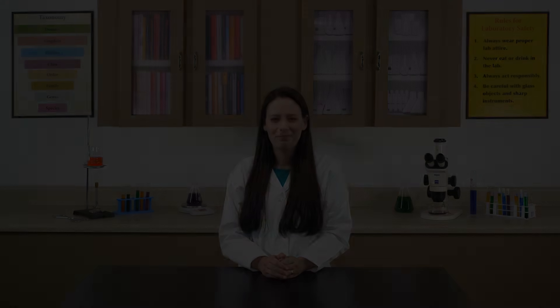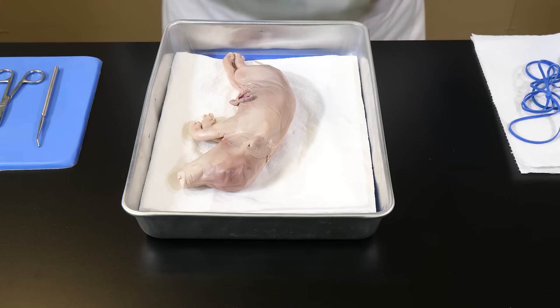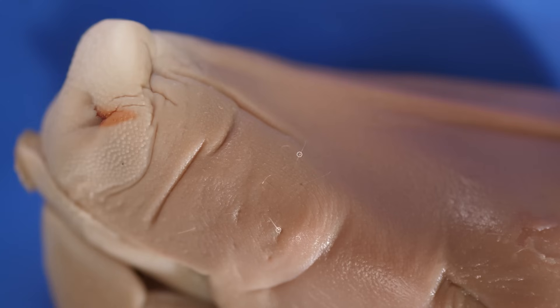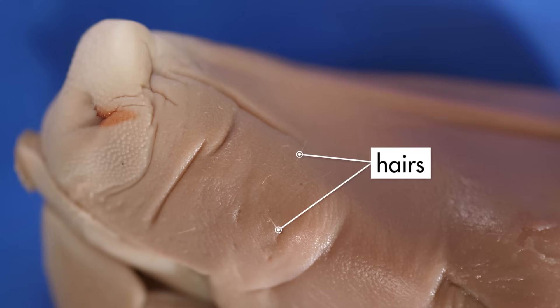In this lab, we will examine the external anatomy of the pig and then perform a dissection to explore its digestive and excretory systems. One of the distinguishing features of a mammal is hair. However, at this stage in its development, the fetal pig has only a few hairs.